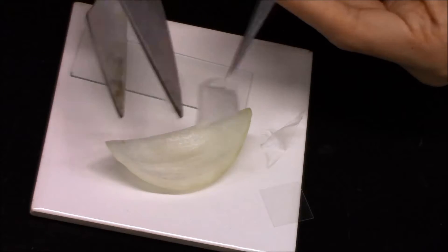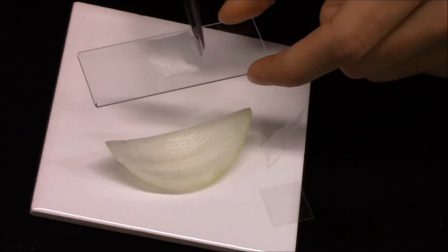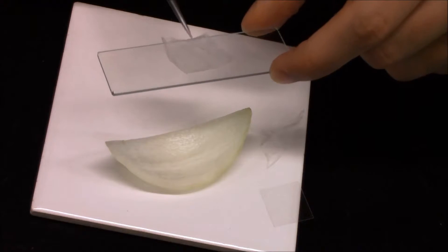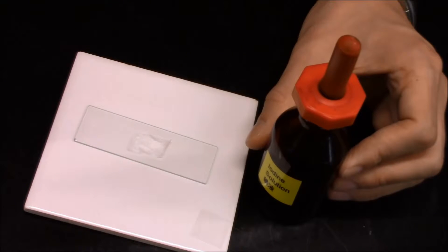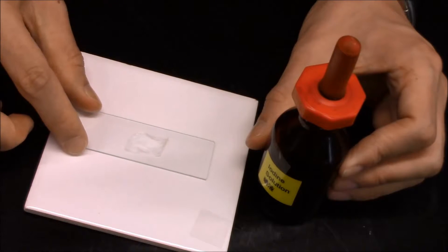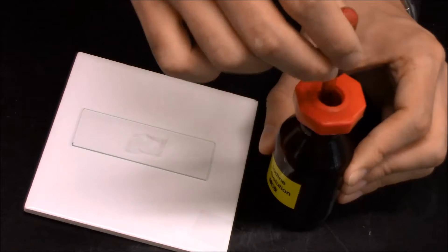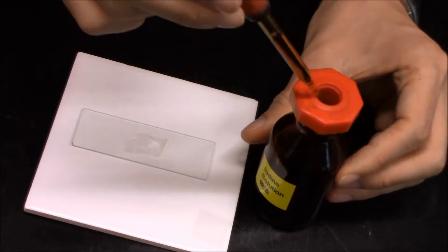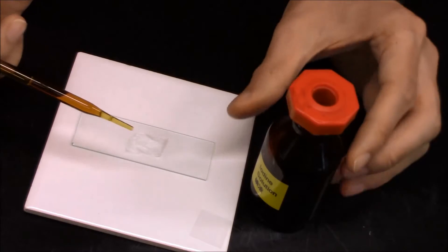So this size is acceptable. You can place it on the microscopic slide. Now you see that we placed the very thin layer of the onion epidermal cell here, but actually it's colorless, it's invisible now. So what we need to add is add some iodine solution.